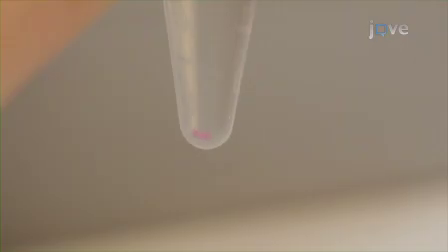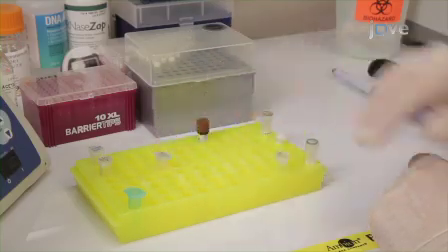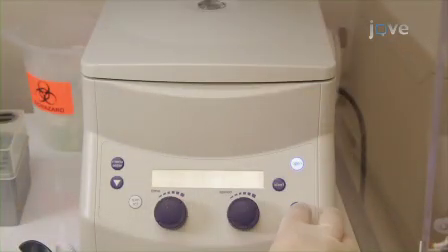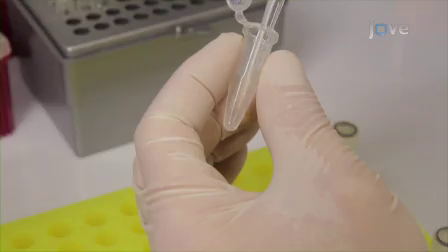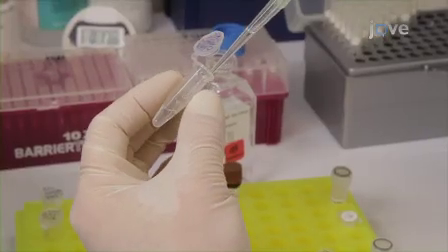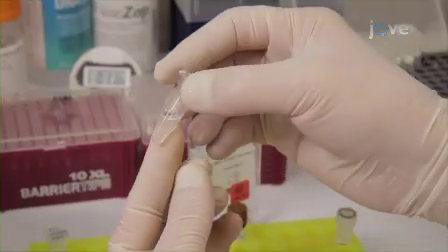If the pellet becomes detached, you can get it back to the bottom of the tube by either placing the tube back in the rack and letting the pellet settle to the bottom, or centrifuging the tube at full speed for 15 seconds. Next, use a P1000 micropipette to carefully remove the ethanol without disturbing the pellet. Tip the tube to enable removal of as much liquid as possible. Add a new aliquot of cold 80% ethanol, cap the tube, and invert it slowly several times.